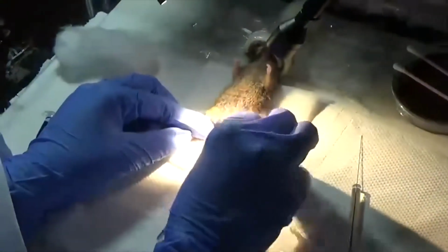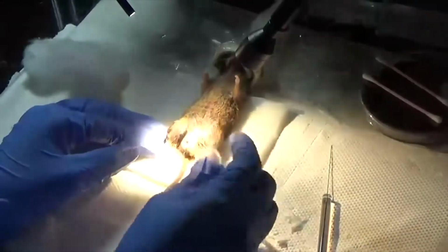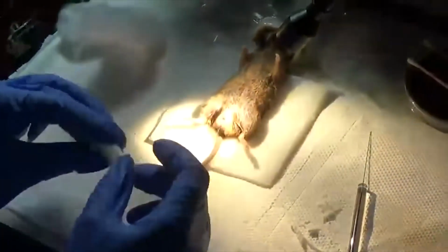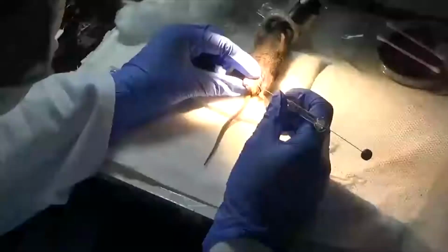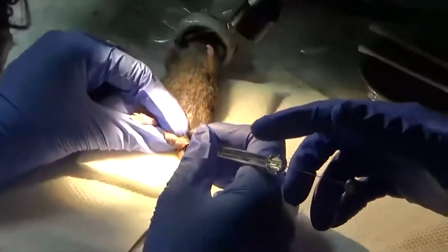What is this syringe? This is a special kind of syringe, a Hamilton syringe, that does not damage the skin and can still enter into the skin and deliver our transgene directly into the germ cells of the male. We target the germ cells present in the seminiferous tubule. Akansha, can you please press the syringe when I keep it?